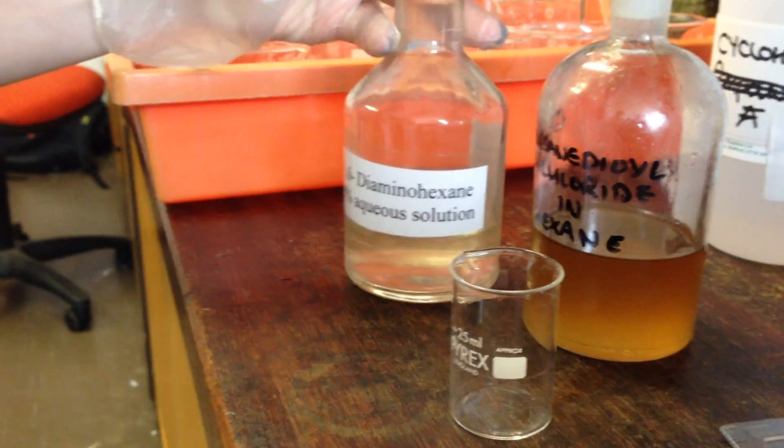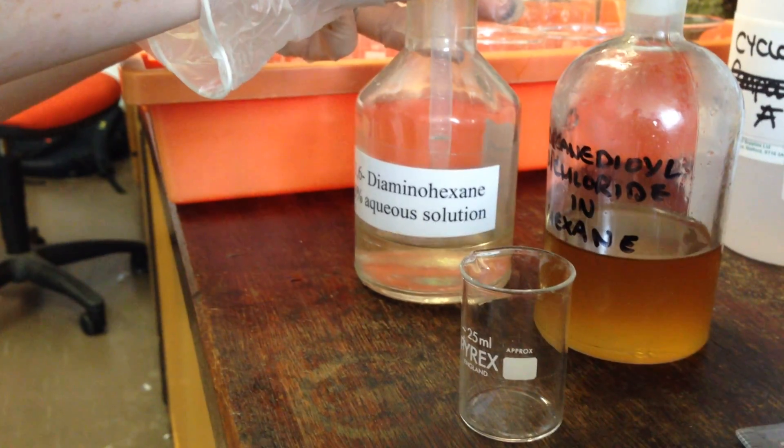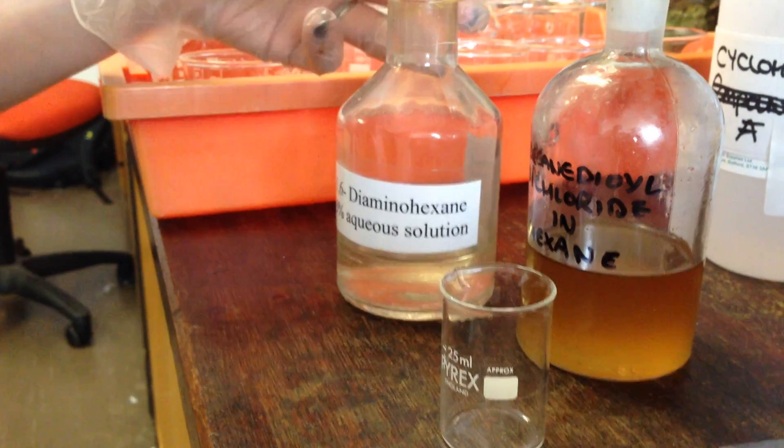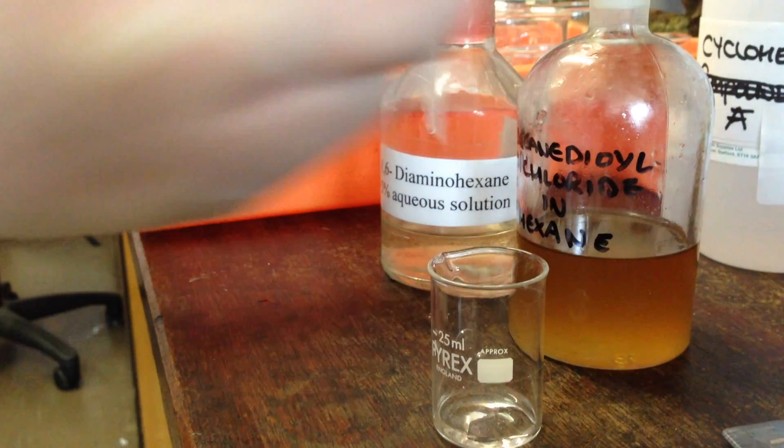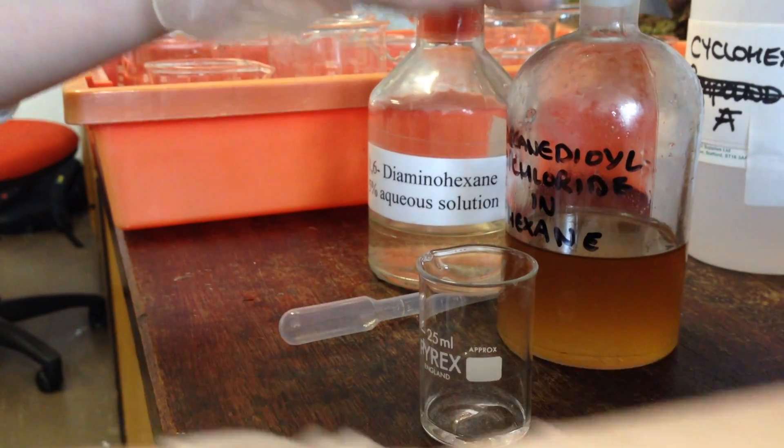Okay, so here we are going to be making nylon. This is an incredibly dangerous and nasty experiment, so it should always be done by your teacher.